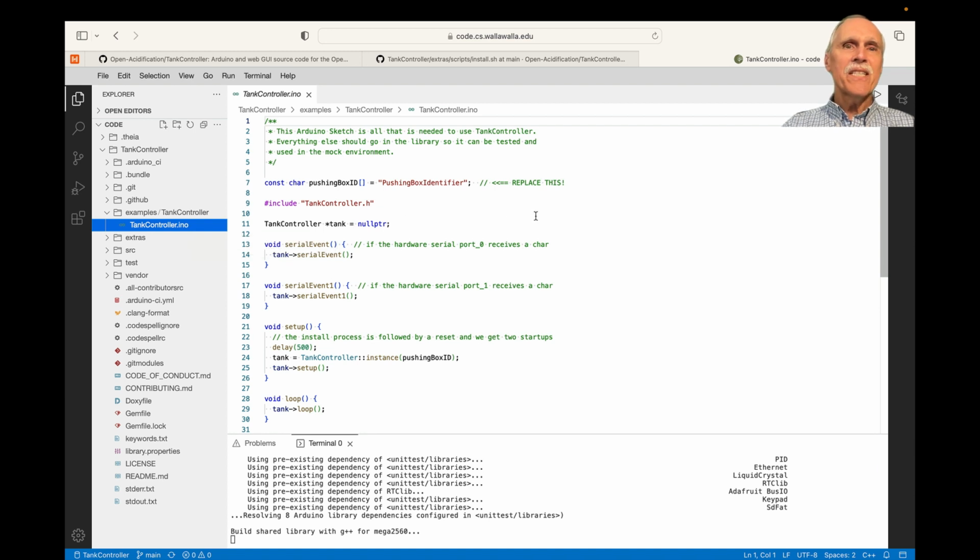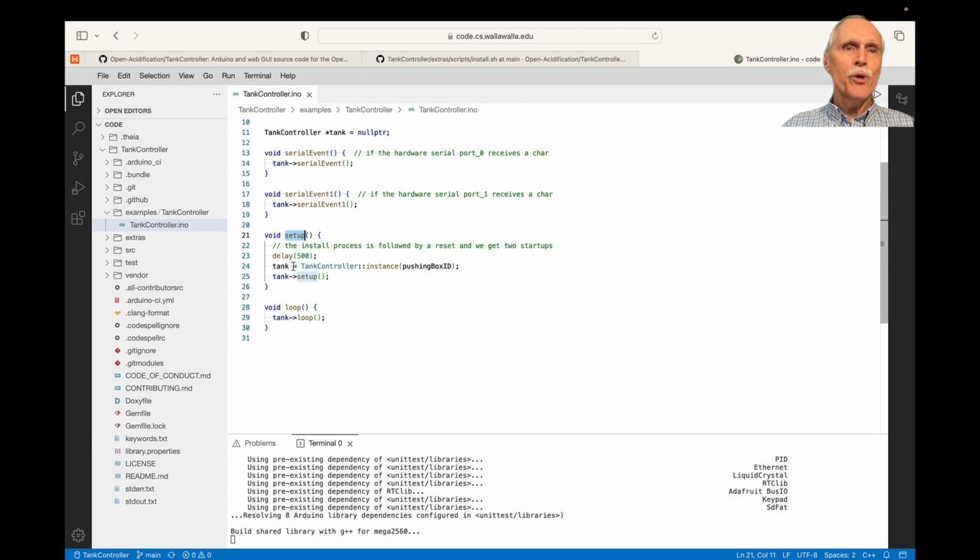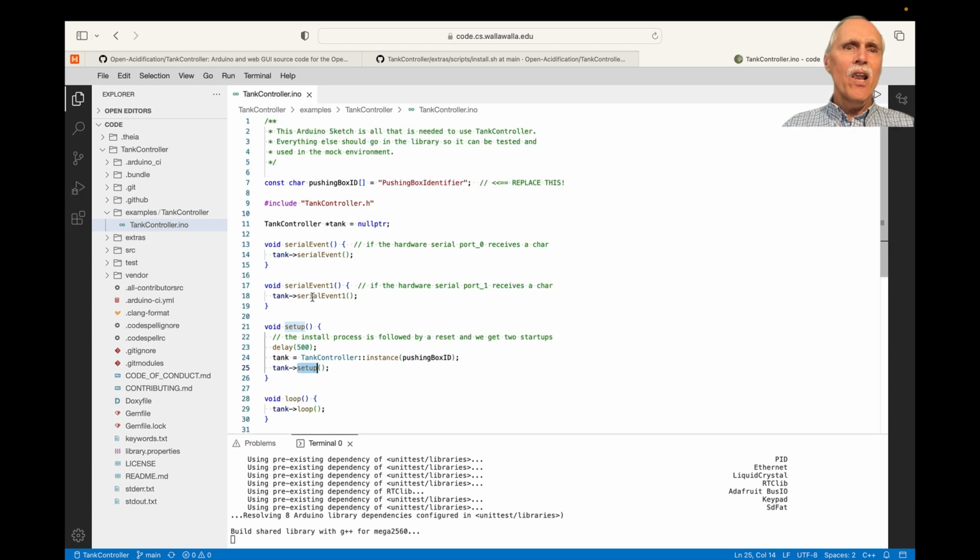Here we have a very simple INO file that has a setup routine that creates an instance of the TankController and calls the setup on that TankController, and then a loop function that calls loop, along with serial events that simply pass on the serial events. So this is a trivial INO application that simply passes on all the methods to the library.